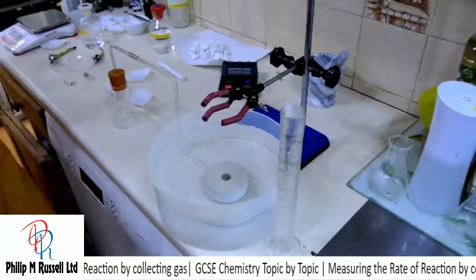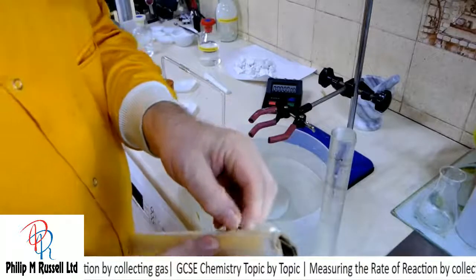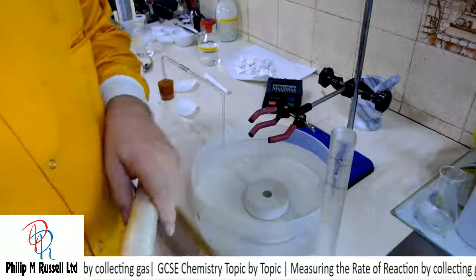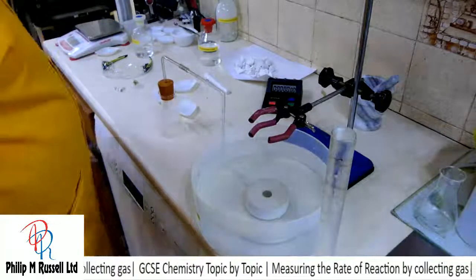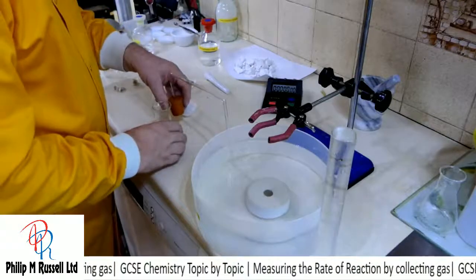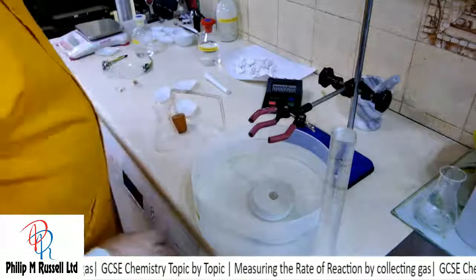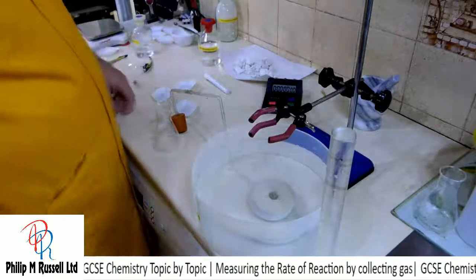and this involves just a piece of cling film. My hardest job with the cling film will be to get a piece off, and that will magically appear for me in a moment. Right, so we're ready really with this experiment, and what we're going to do is try and look at this.